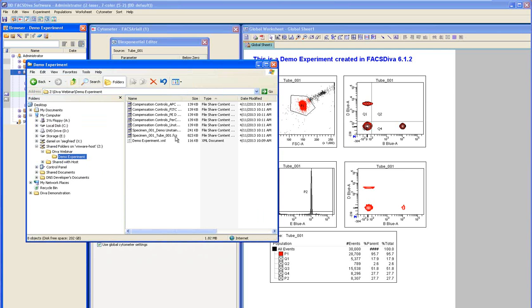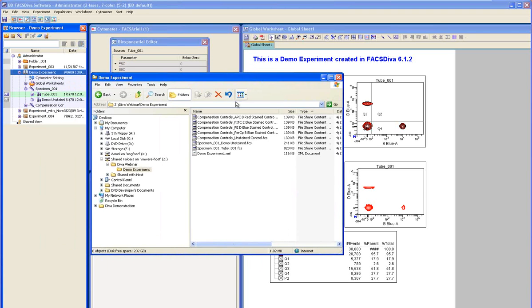we can see that there are a number of files that are more explicitly named. You have the tube name and you have the sample name. You have the specimen name. So with these files, we can now go into FCS Express and import the experiment.